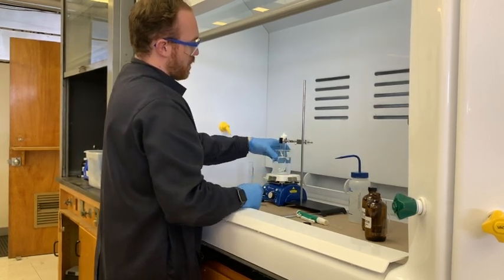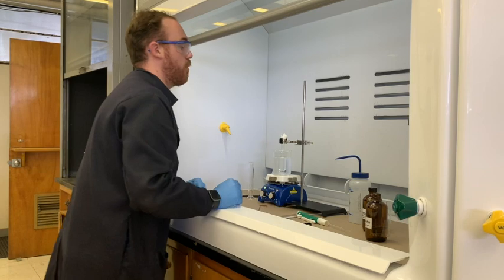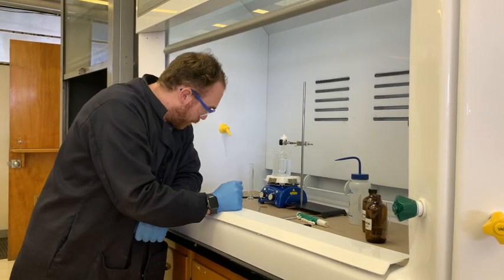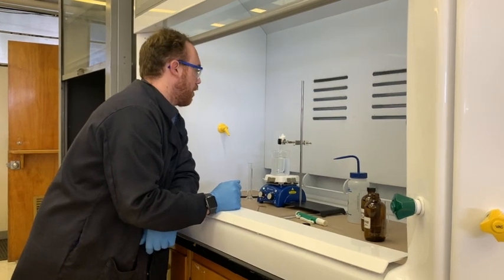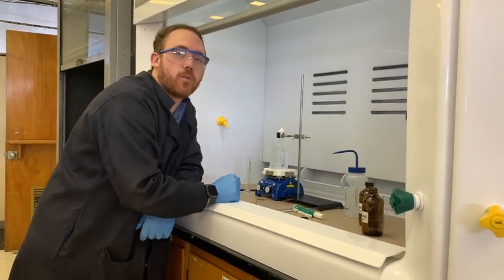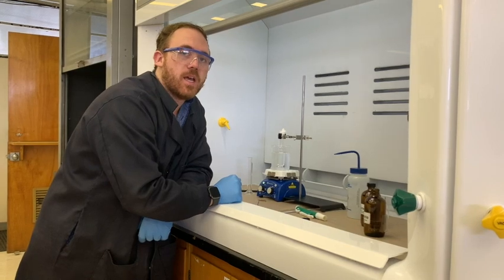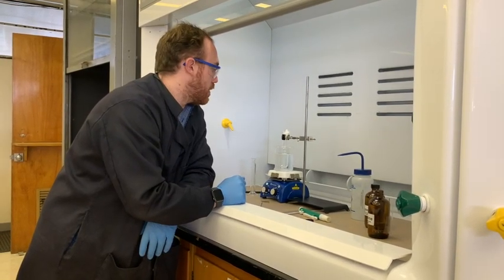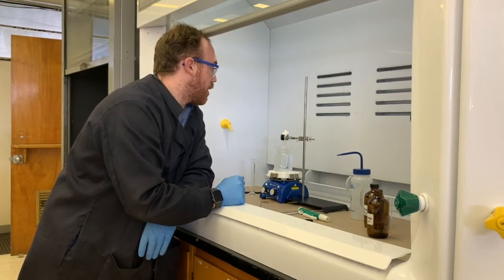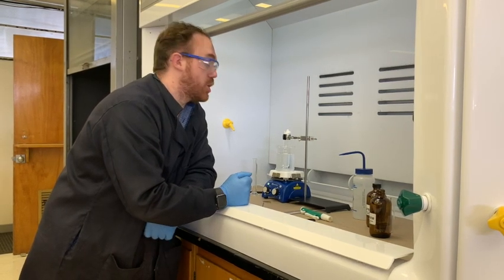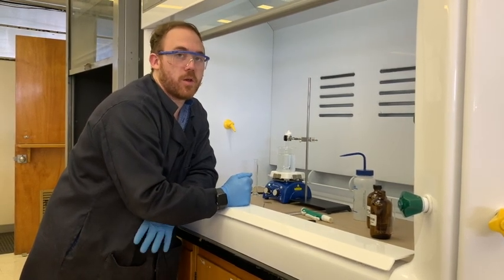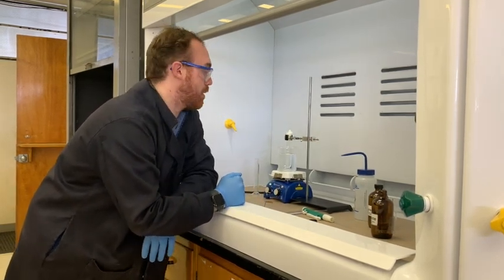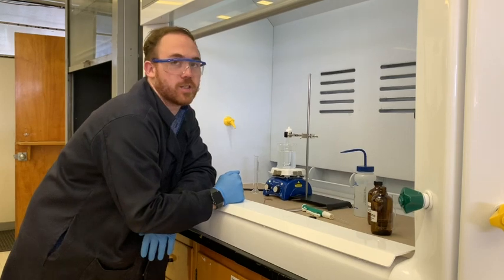And then you're going to place that carefully into the hot water bath. And you won't really need to stir this, you just need to let it sit there for about an hour, and then you're going to have the reaction closely complete, it'll be a little thicker, so you should keep an eye on it throughout the entire hour just to see if you notice any visible changes. Like once you see the styrene polymerizing, is it going to change in solubility? Hard to say unless you already know what to expect, so you should always keep an eye on it, no matter how long the reaction is going to actually take.